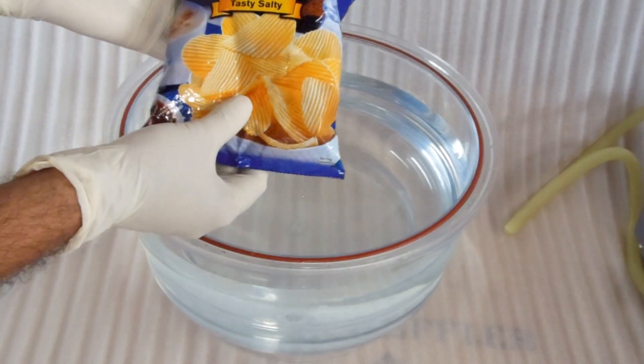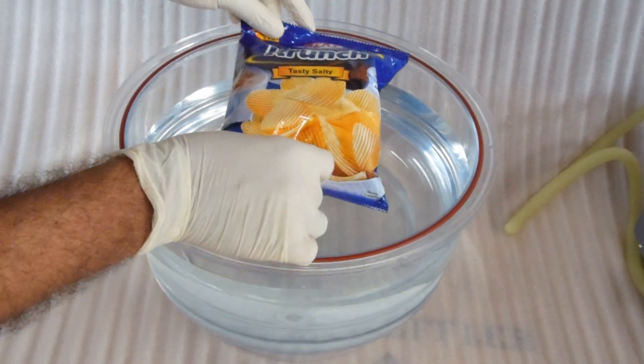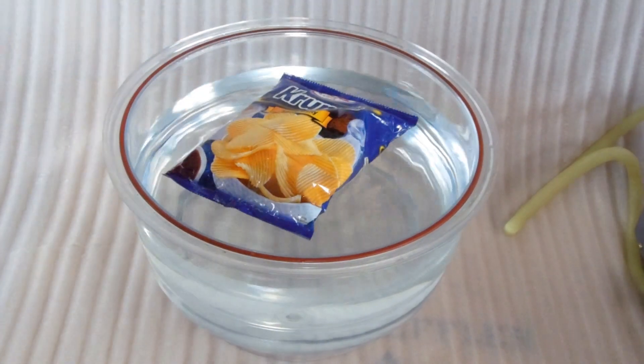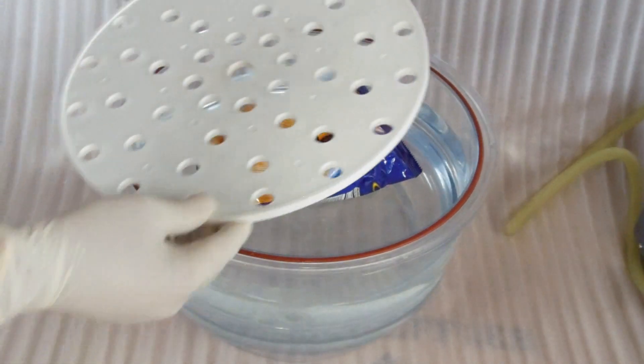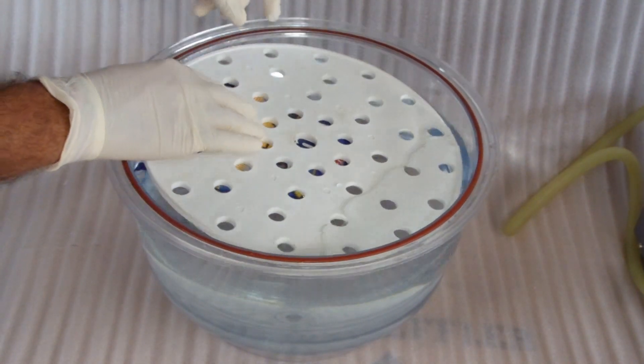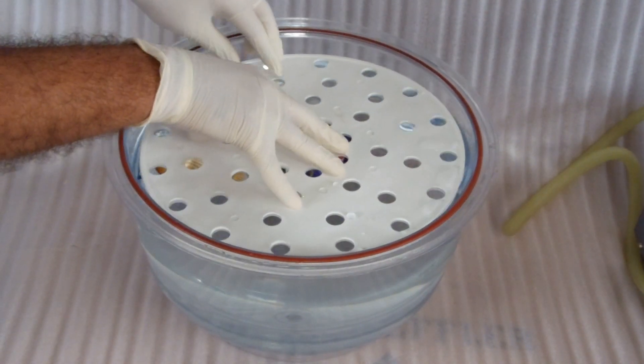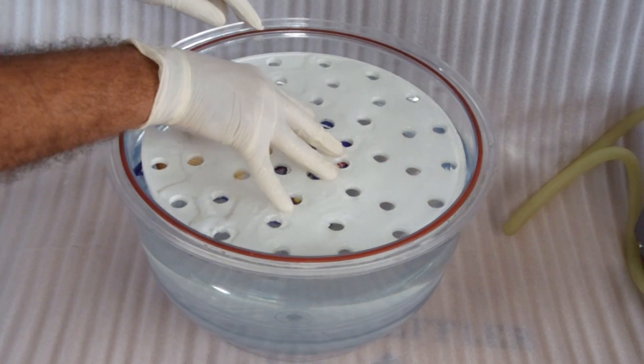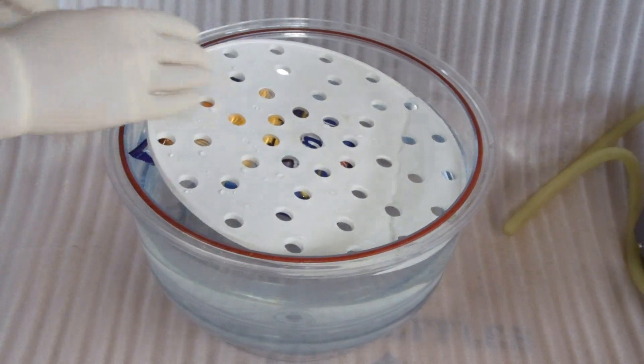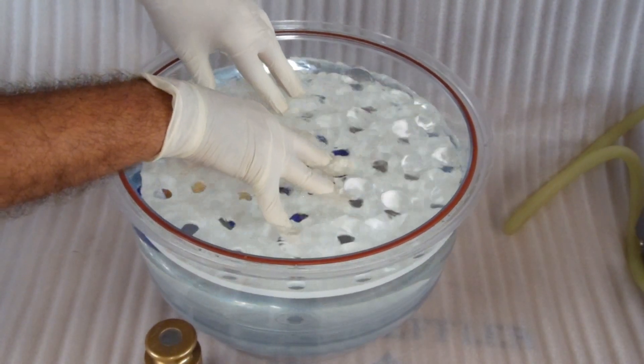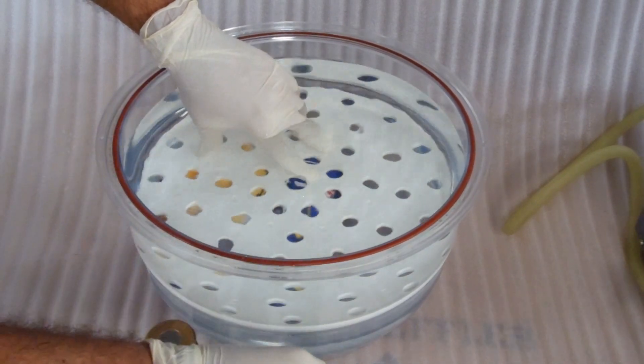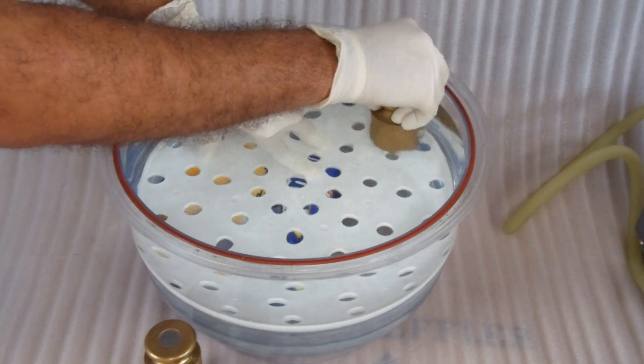Take the pouch sample and place it in water. Place the perforated plastic plate over your sample. If the sample still floats, you will need to place some weights to hold it down during testing. Use any non-ferrous metal to avoid rusting.